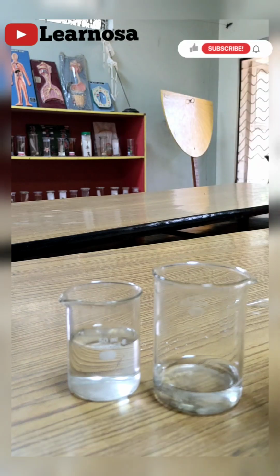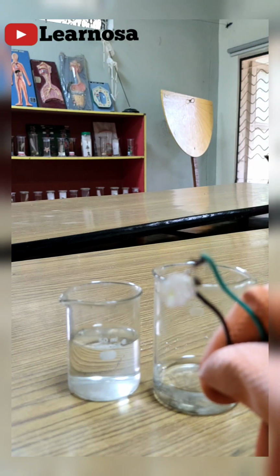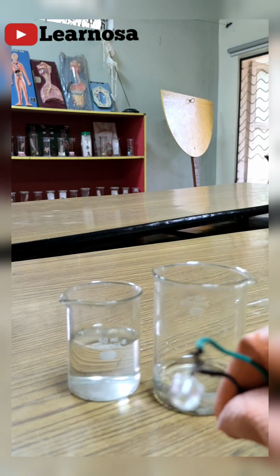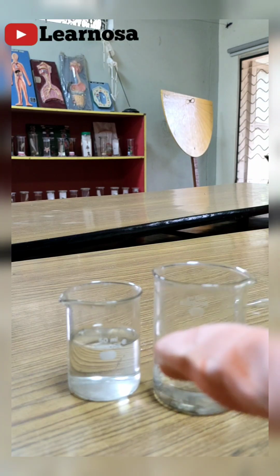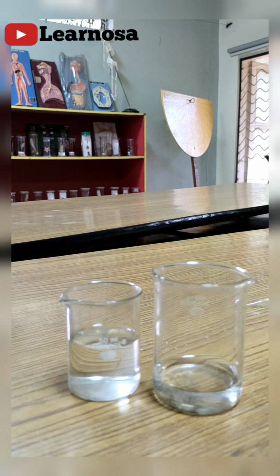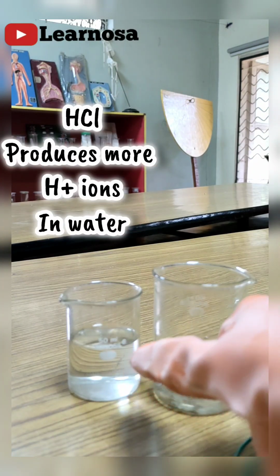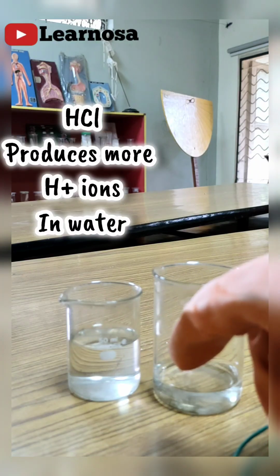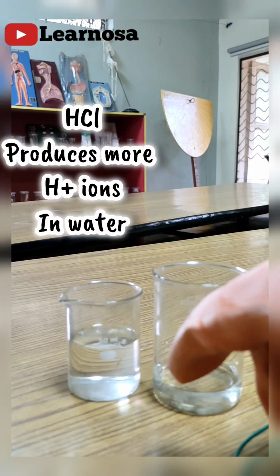The main difference is the intensity. The light is glowing, which means both have ions and both are good conductors of electricity. But in acetic acid the bulb glows with less intensity, and in hydrochloric acid the bulb glows with high intensity. Can you guess the reason? Yes, here the concentration of H+ ions matters. In hydrochloric acid the H+ ion concentration is much higher, meaning more H+ ions are produced when HCl is added to water.